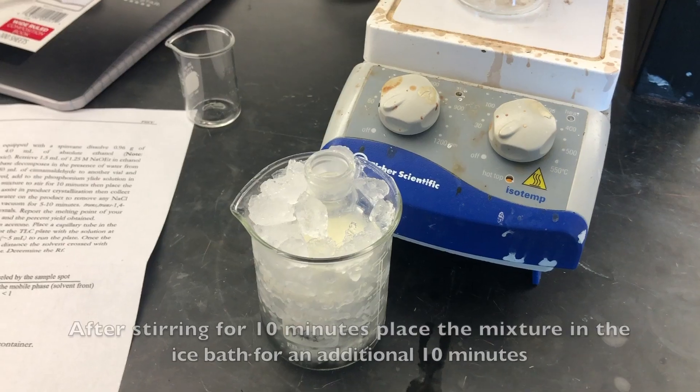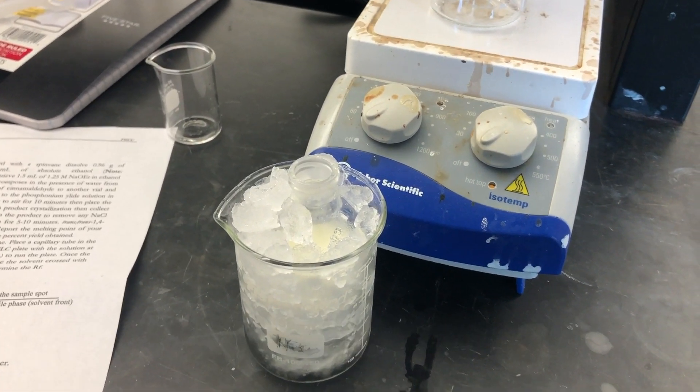Collect ice to make an ice bath. After stirring for 10 minutes, place the mixture in the ice bath.